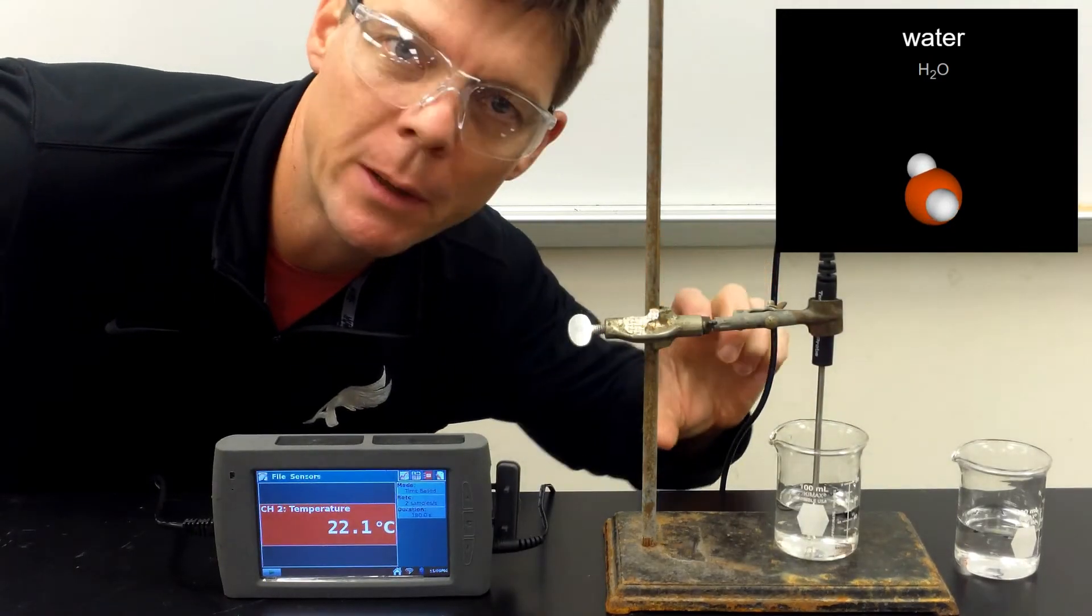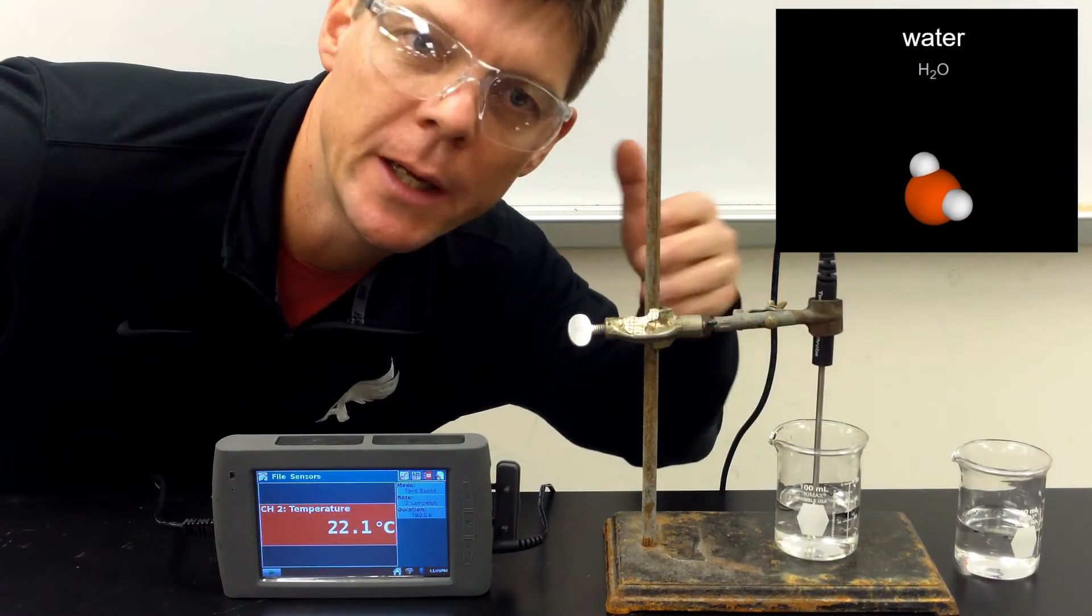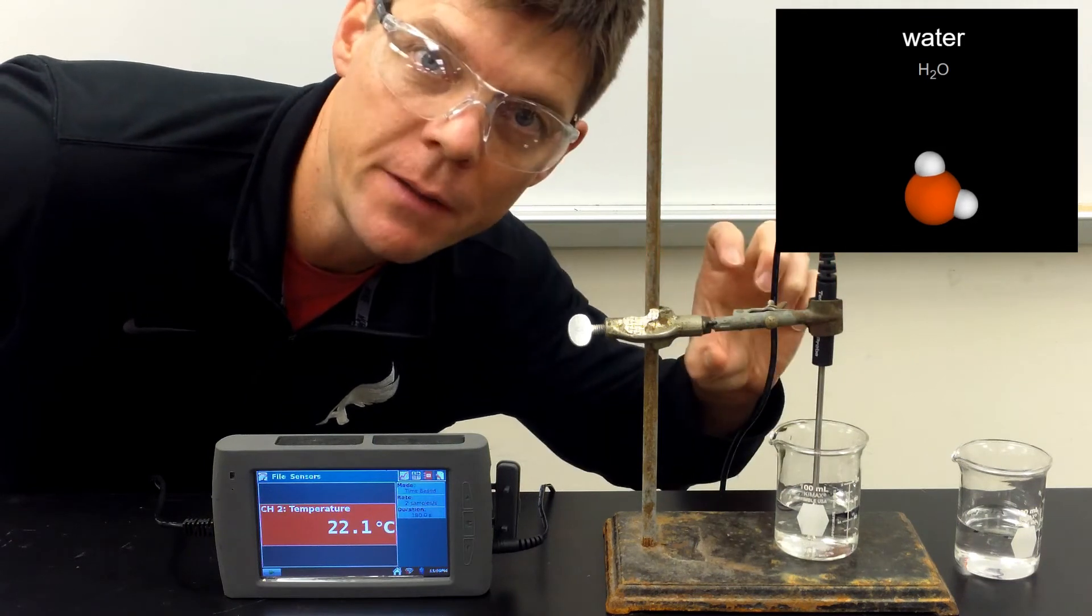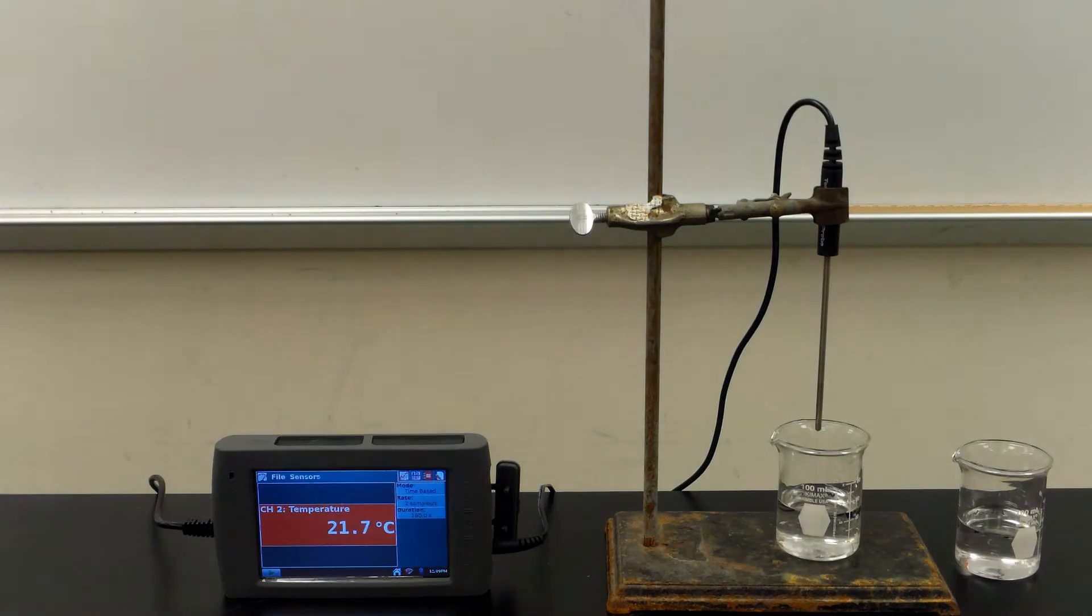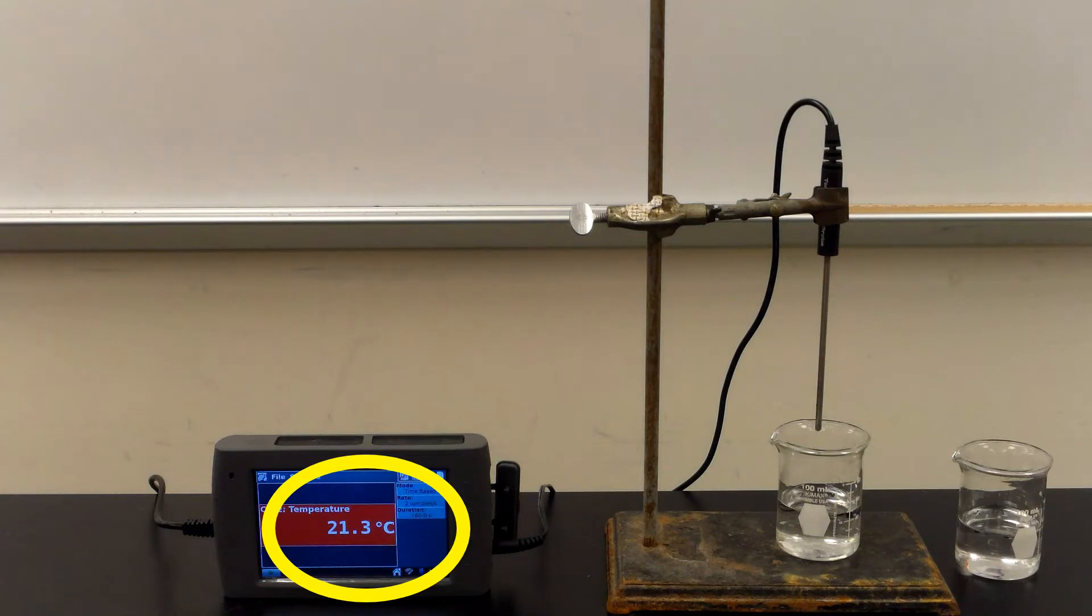Now we're going to raise the probe up and once we lift it out of the liquid, the liquid that remains on the tip of the probe will start to evaporate. And we can see that the temperature is falling.